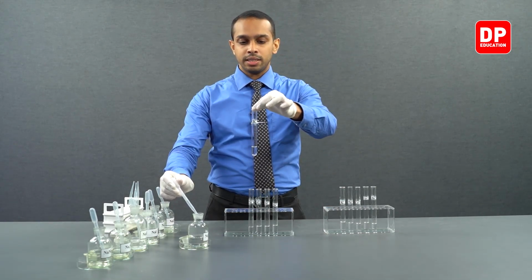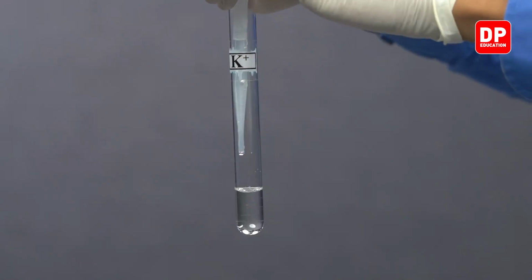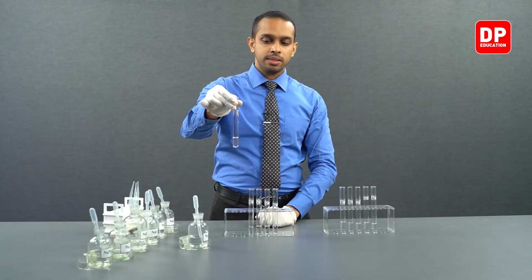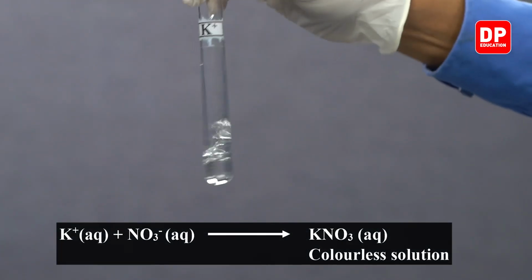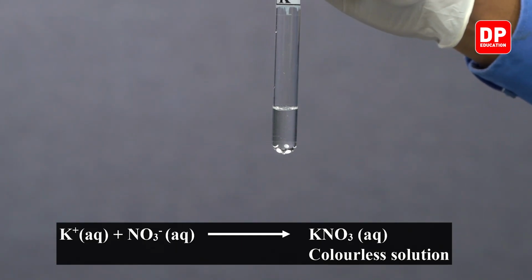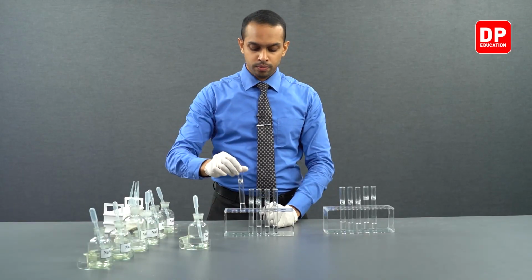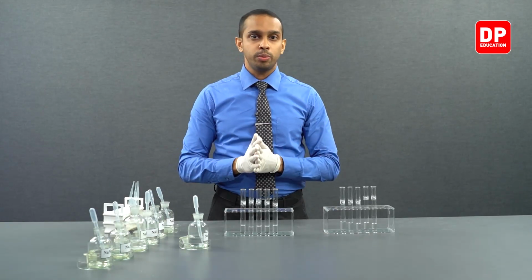Let's take our potassium 1 plus aqueous ion solution and add nitrate ion solution and see what happens. As you can see, when nitrate ions are added to potassium ions, we form potassium nitrate, which is soluble in water. In fact, all of the group 1 nitrates are soluble in water.